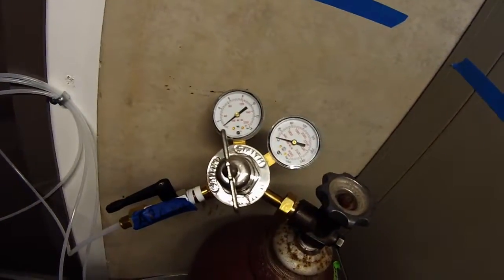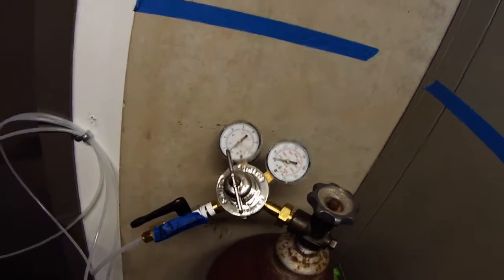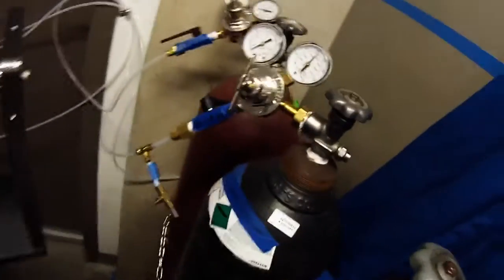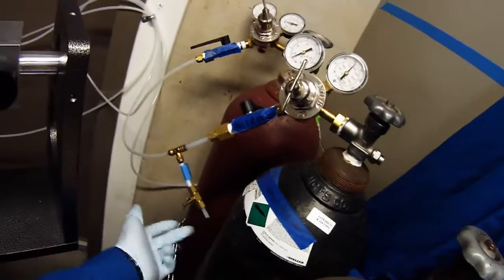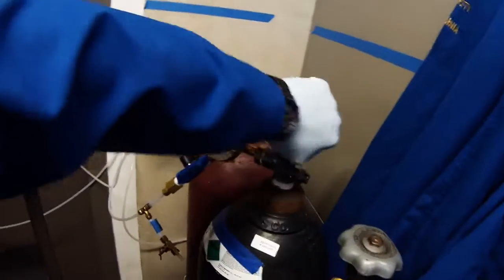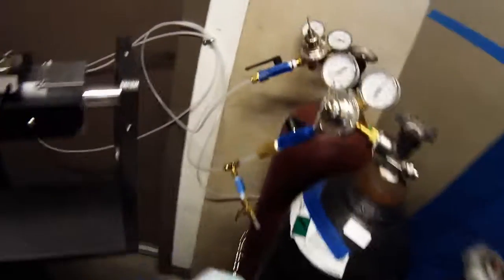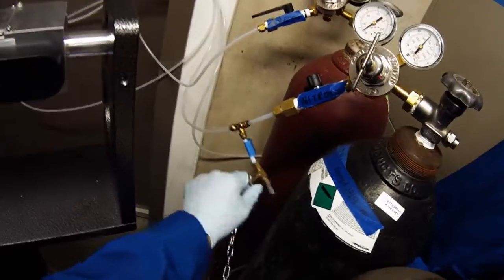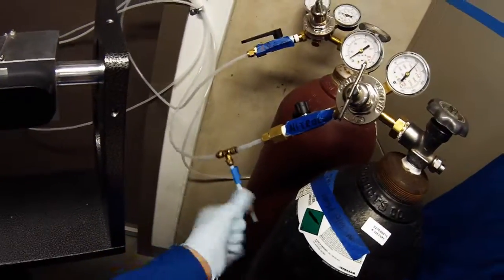The argon tank is back here and it's off, so we'll go ahead and turn it on. Pressure is about 10 PSI - we want it between 8 and 10 PSI because that's the maximum the mass flow controllers can take; any higher could damage them. Here's the nitrogen - it's left open to atmosphere every night, so when you come in you turn the nitrogen on, burp all that air out of the line for a couple seconds, then close it and turn it up all the way.